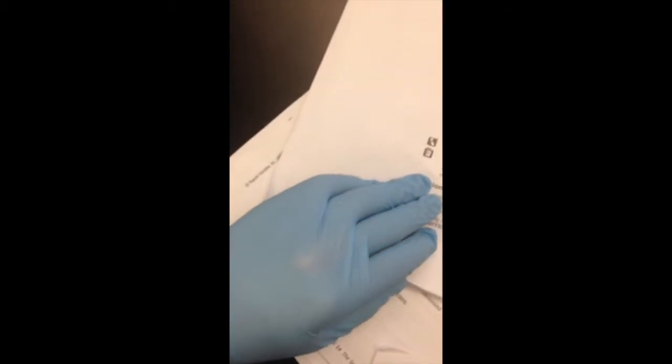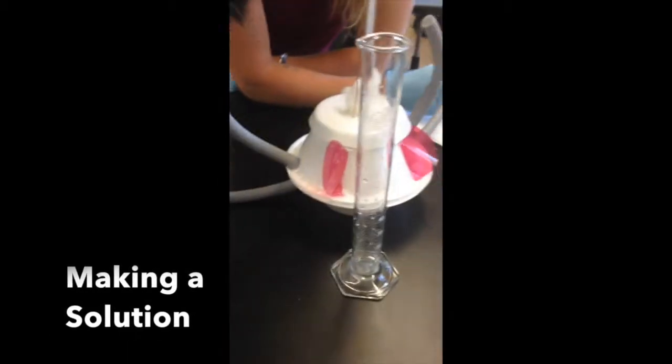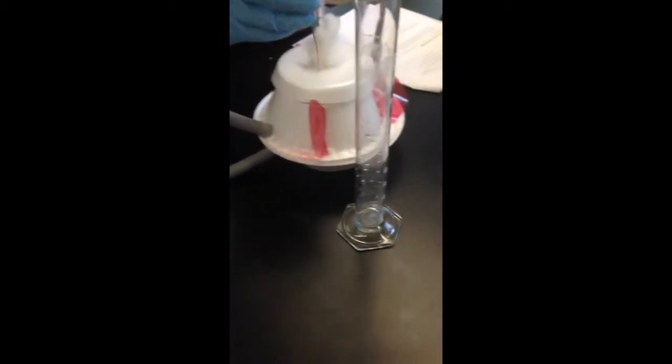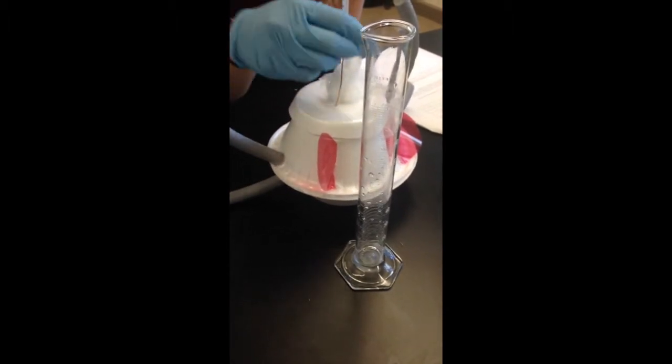The first part, we're mixing NaOH and water. The second part, we're mixing NaOH and hydrochloric acid. Here's our first reaction — it's actually a reaction of dissolution. We have sodium hydroxide pellets dissolving into water.